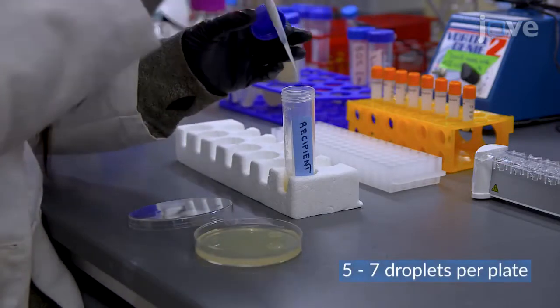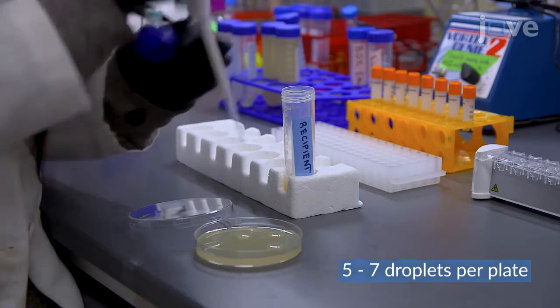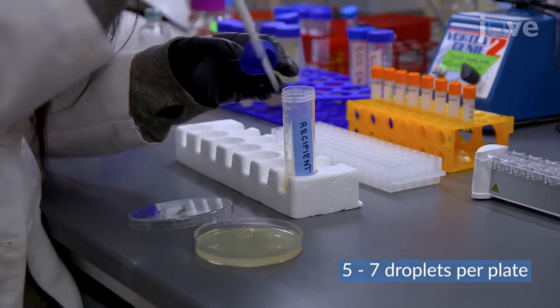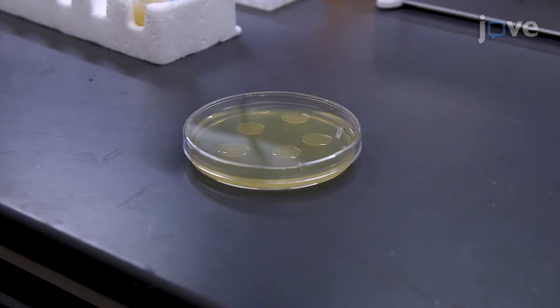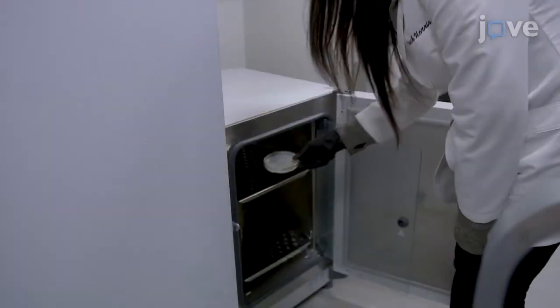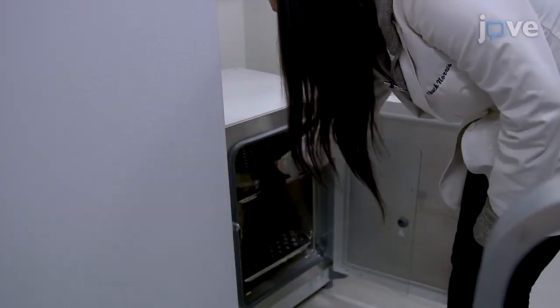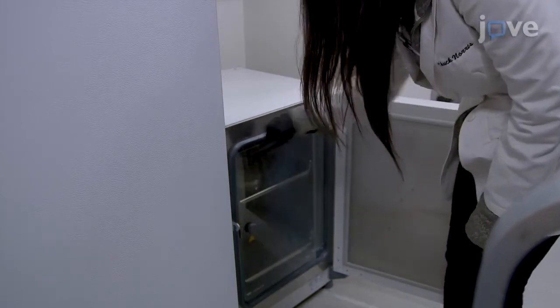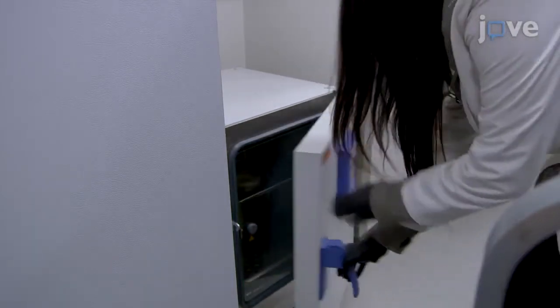Distribute the droplets on LB agar plates supplemented with diaminopimelic acid. Incubate the plates at room temperature for 30 minutes. Then carefully transfer the plates to a 37°C incubator and allow the cultures to mate for 1 hour.